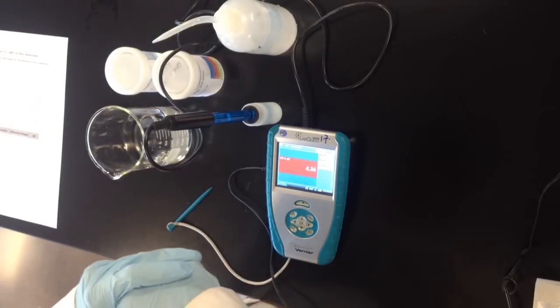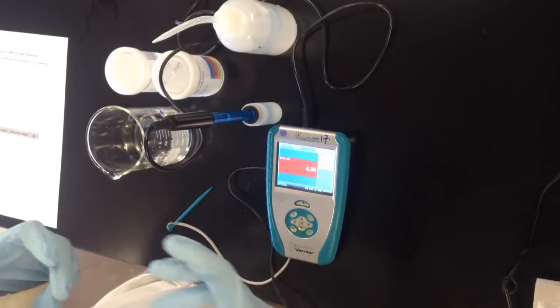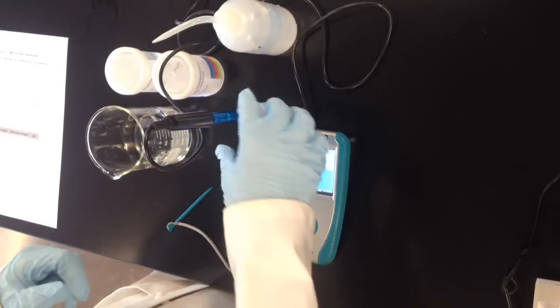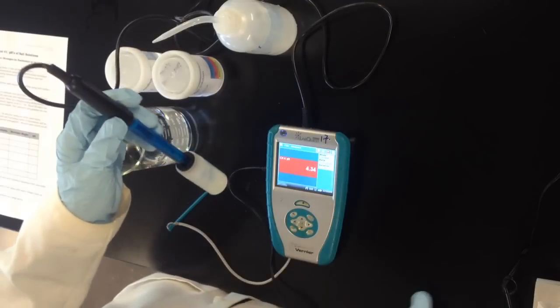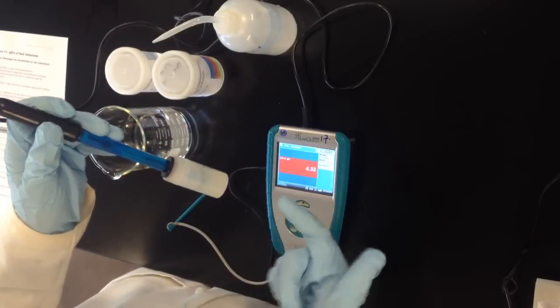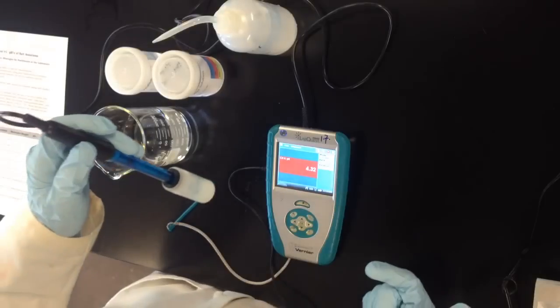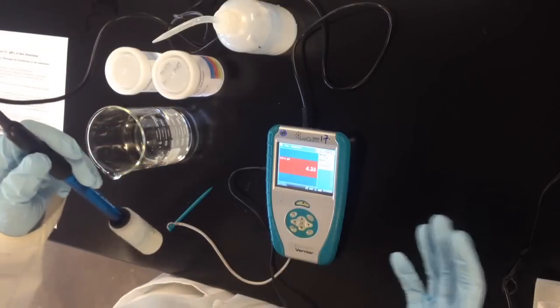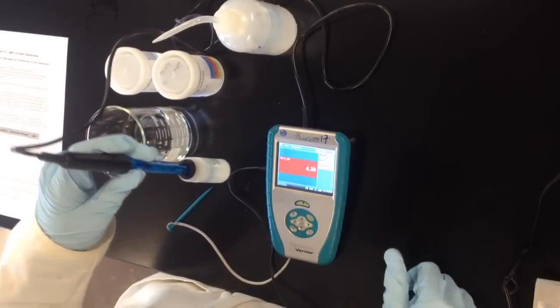In this video I want to talk about how and why to calibrate a pH probe. The blue LabQuest pH probe looks something like this and it'll come in a vial of storage solution. The pH that you'll see when you plug it in will be about 4, maybe 3.5, maybe around 3 something like that.